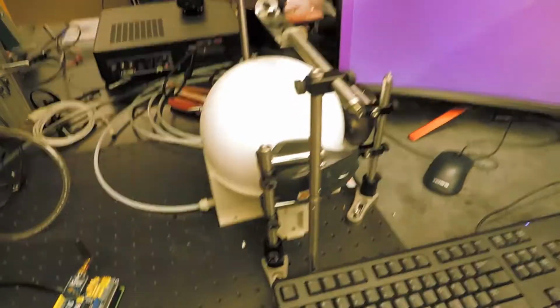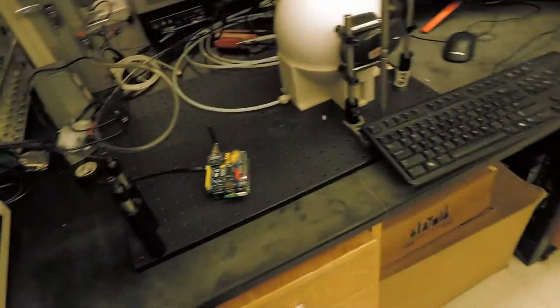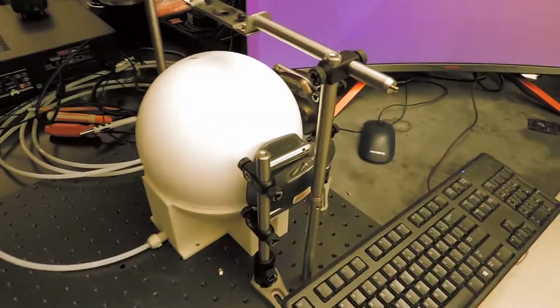Hello, Hackaday. I'm here at the lab with the Telepresence robot for the lab mice, and it's all set up right here. And I just wanted to show you what we got cooking.